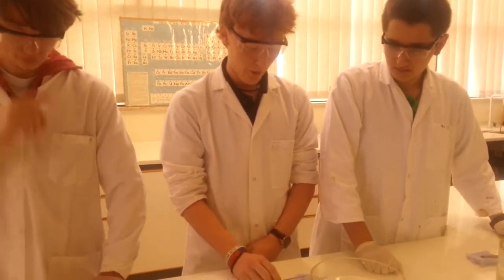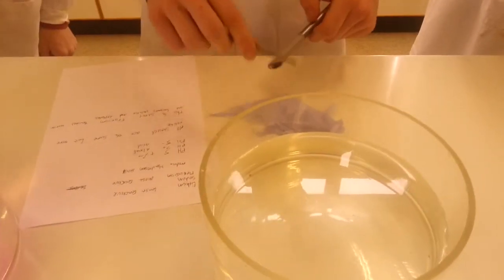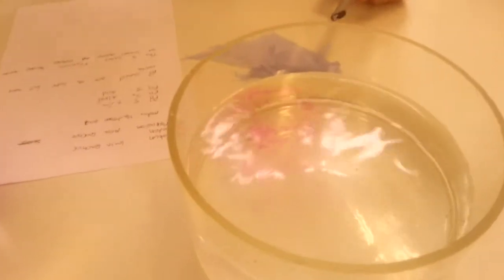Now we're going to move on to sodium. This is going to go horribly wrong for me, I can tell already. There, as you see straight away, it starts to fizz and move around. It's like a ball. And it's much louder than lithium because it's much more reactive.